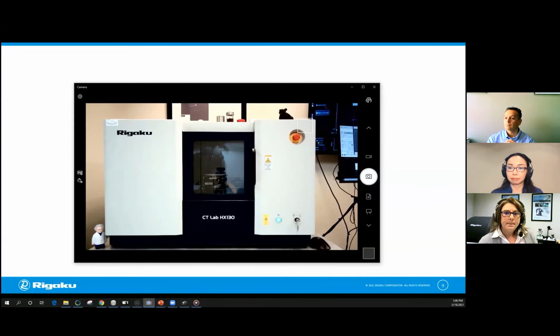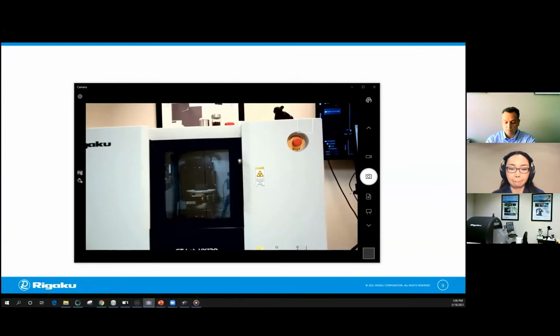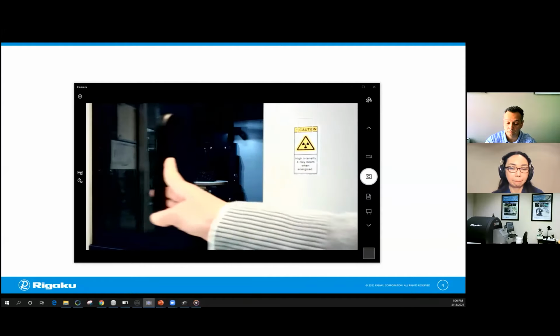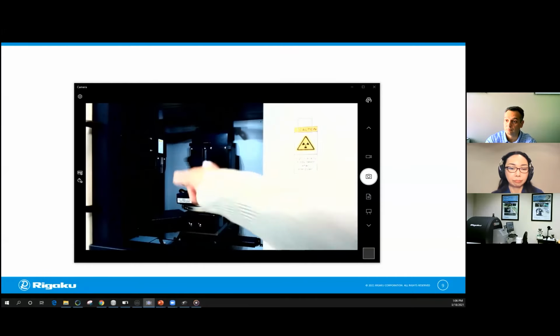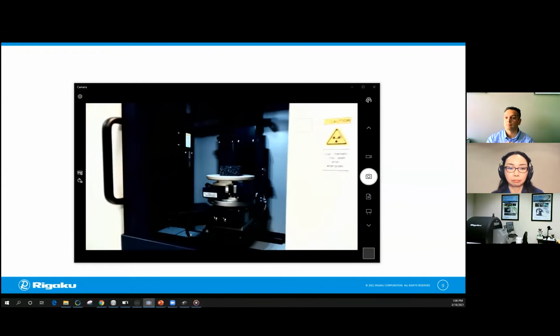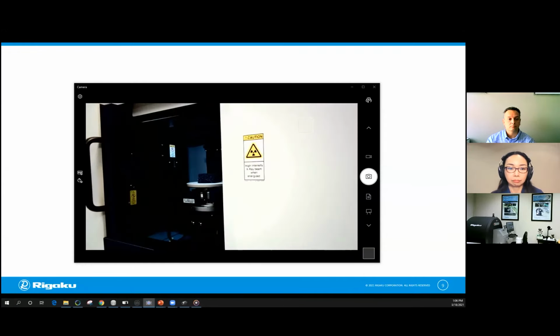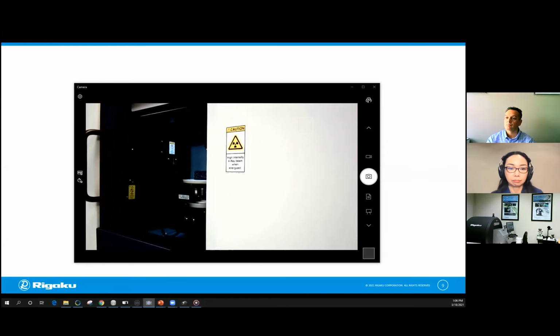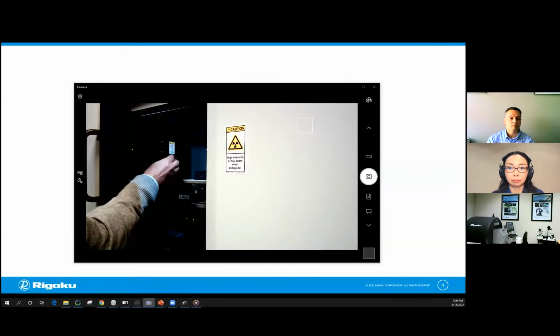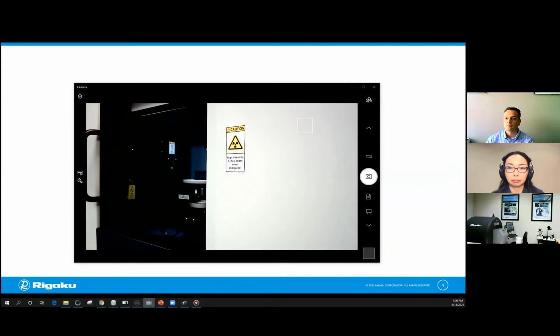We're going to just have a quick look. I'm going to move my camera just a little bit. You'll see that I have some foam material on the sample stage where I'm going to place the sample. It's dark, and I did that on purpose so that we can have some good contrast to see our white sample. And I'm going to place this filter material right here, just downstream of the exit window for the x-rays. So let's make sure it's in place. So you should see it there.